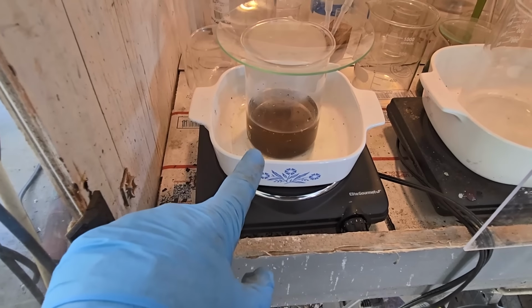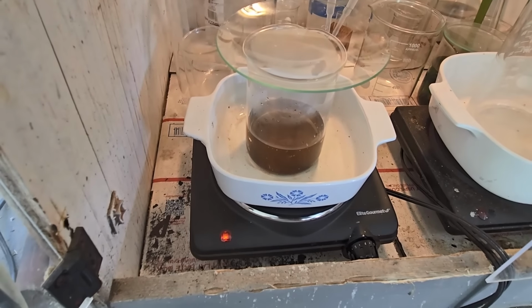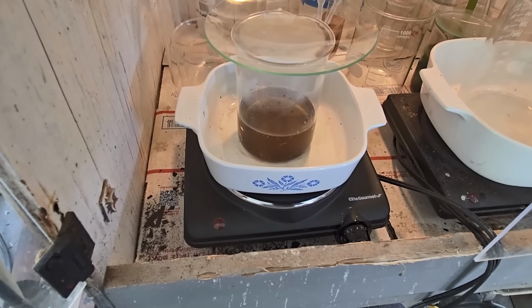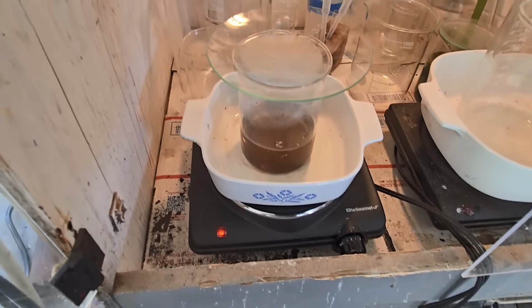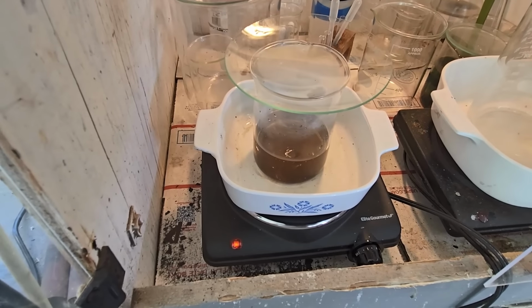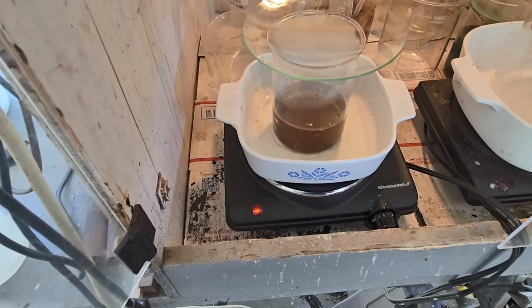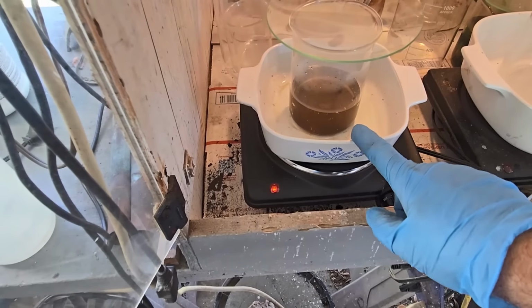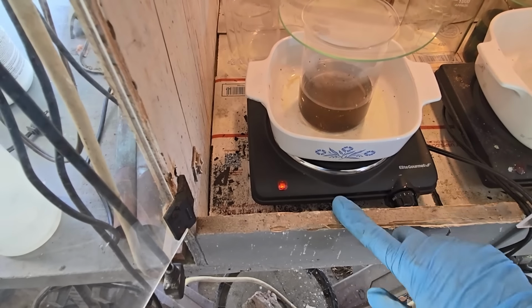I've got the gold transferred to a much smaller beaker with some distilled water. We're going to give it some cleanup boils. It's just now heating up towards its first boil. I'm going to turn the heat up a little bit more and get it going. I'm going to give it at least 3 cleanup boils in distilled water. I will decant the water off between boils through a filter to capture any fine gold that might come over.